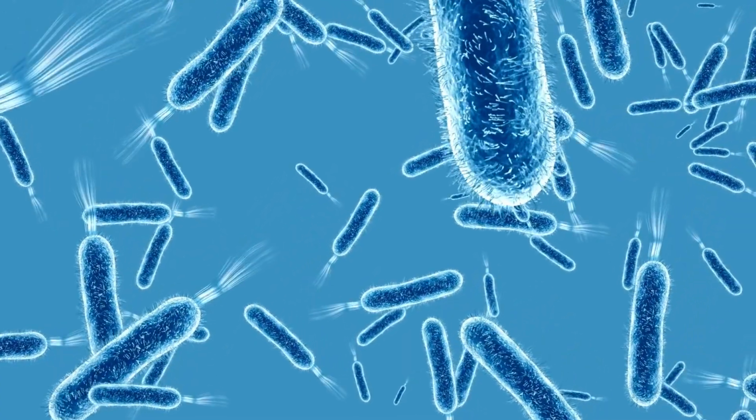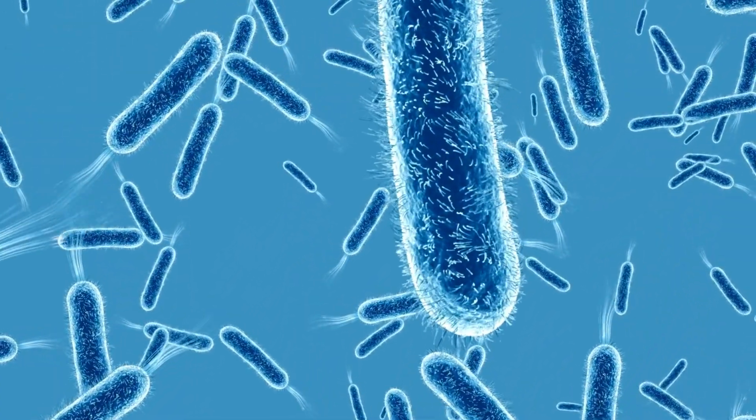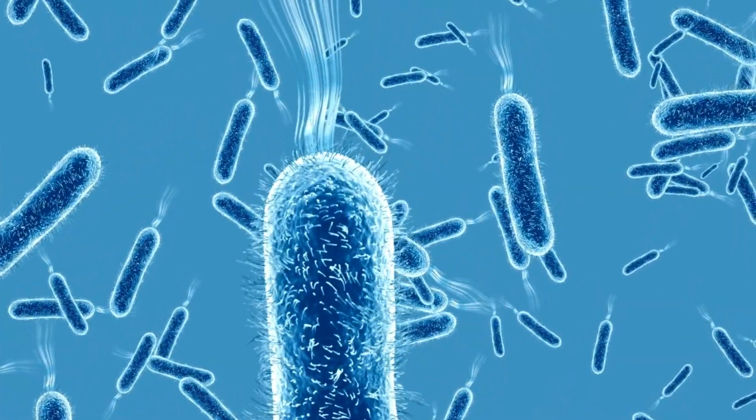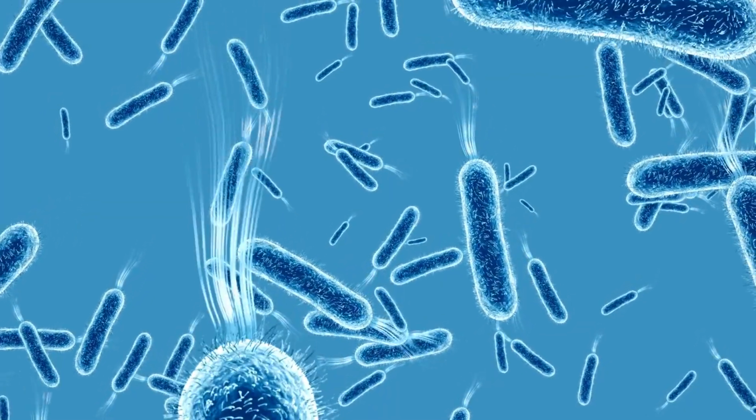If you perform the extraction of microorganisms from commercial products, it is important to bear in mind that the greater the diversity of microorganisms in the product is, the more likely it is to lead to greater contamination. Also, it may be that the microorganism you wish to isolate no longer exists in that product.